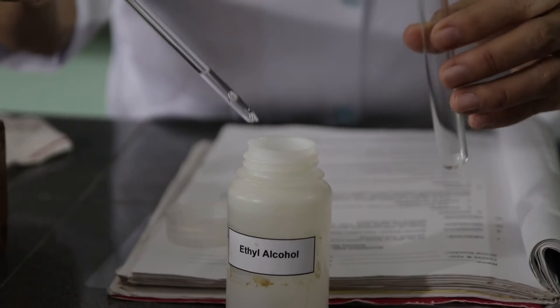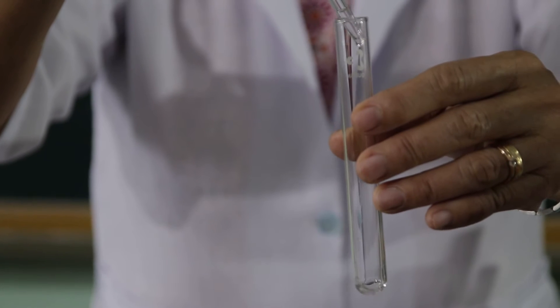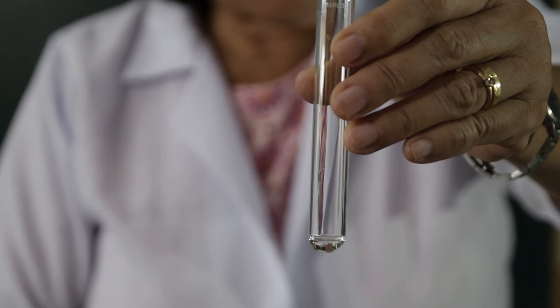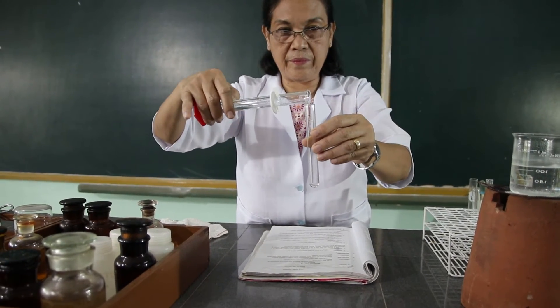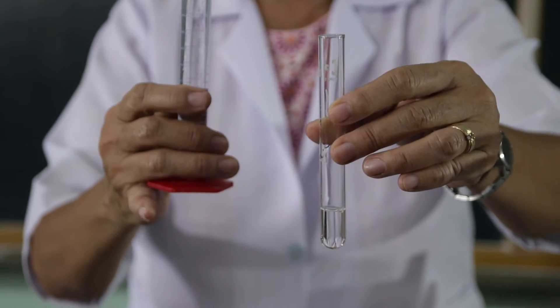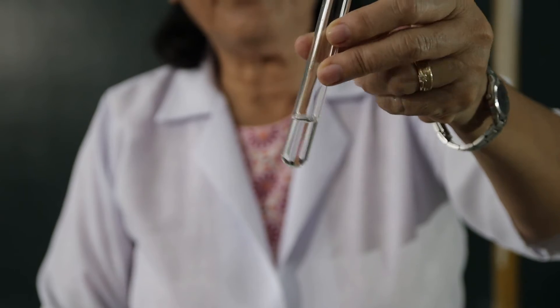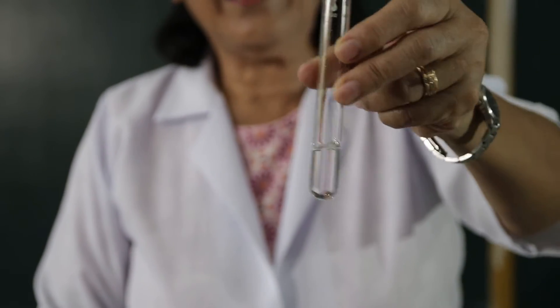For the first part of this activity, we are going to test the solubility of ethyl alcohol in water. Let's get 6 drops of the ethyl alcohol and we will add this with 3 ml of water. Because we are testing its solubility, we are going to shake it to see whether the ethyl alcohol mixes or dissolves in the water.